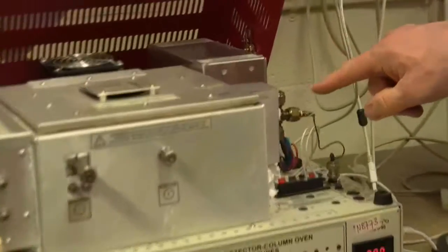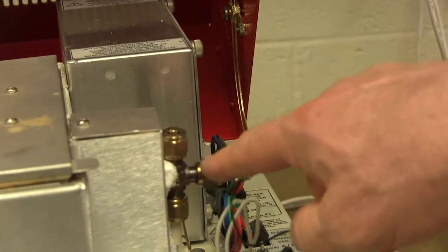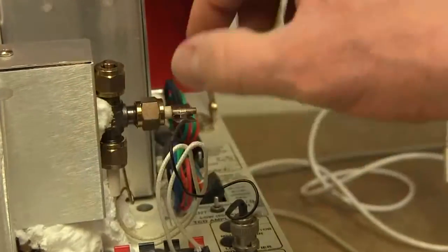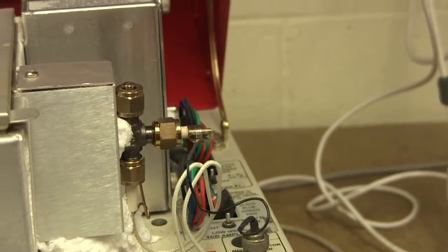So this is an example of what the FID detector looks like in an 8610C GC. So you have to lift the lid, and there it is. It may be here, or here, or here, but it's going to be in one of these three places on every SRI GC.